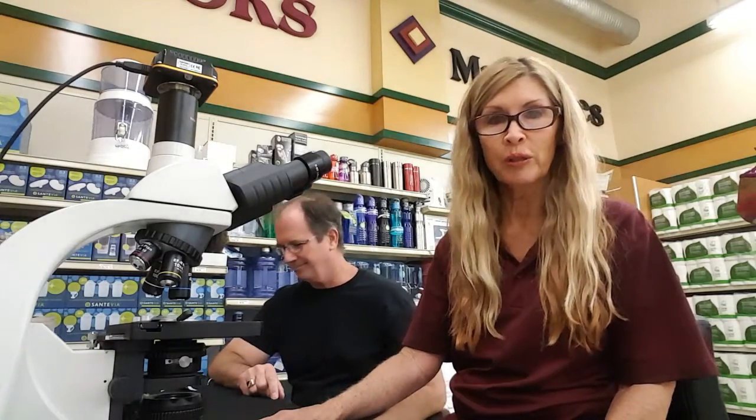And I have a form here that I number 1 through 10 that explains, like, if the blood cells are small, it might be anemia, and then I check off the box. So 1 is where you'd like to be, optimum health, 10 is like you better fix it. So we're going to go to part 2 now. Thanks.